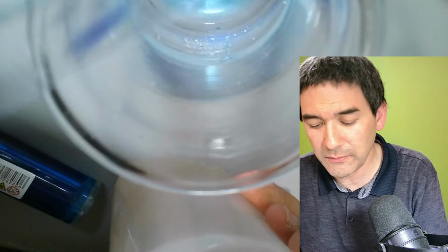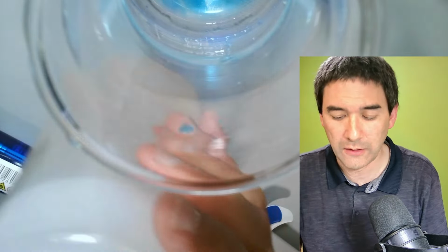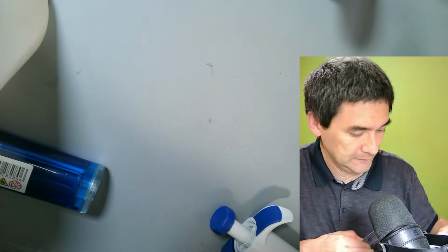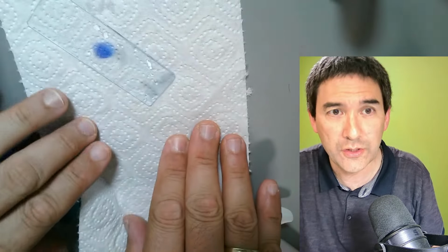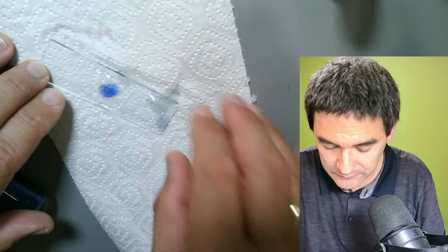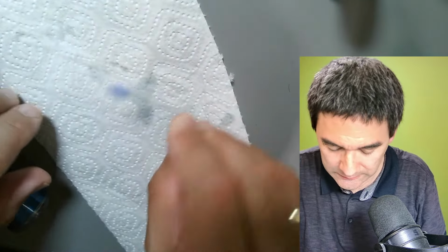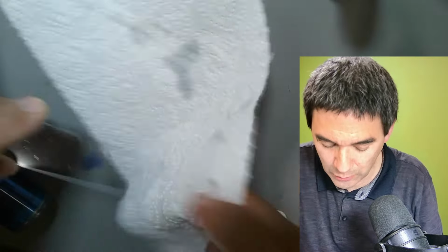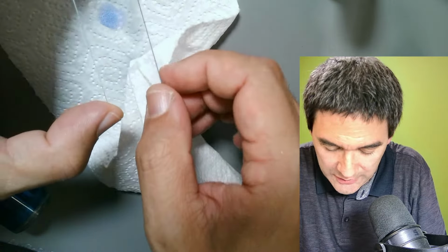This is to remove any excess. And I'm going to now carefully dry the rest. I need some tissue paper. You can actually see how it already stained it properly. Normally you should air dry it as well, or I can use my coffee warmer, which I actually did not take out yet, which is a pity.